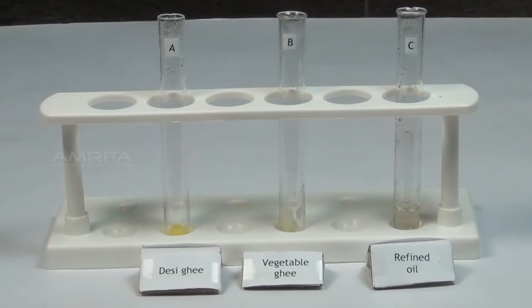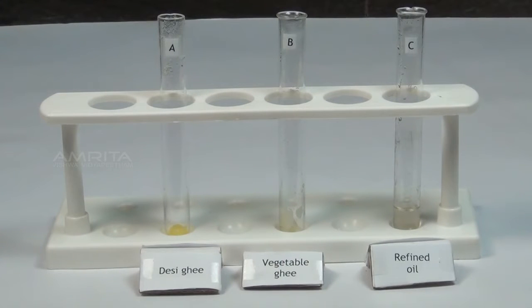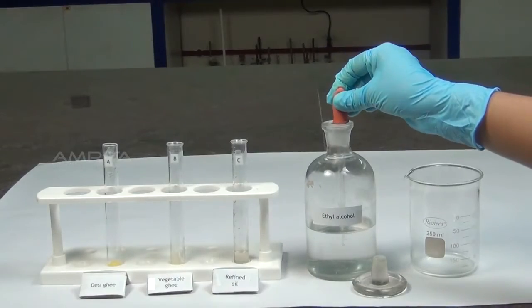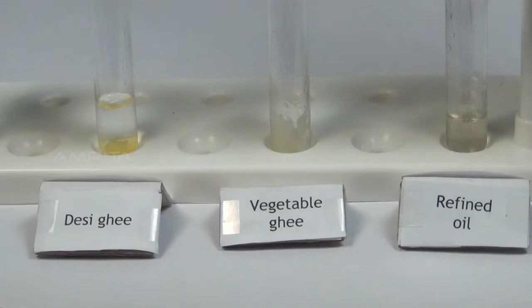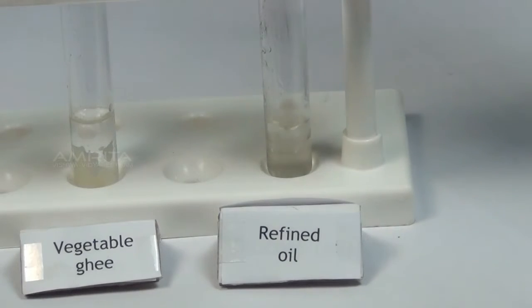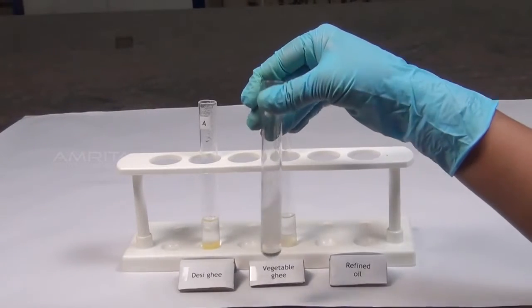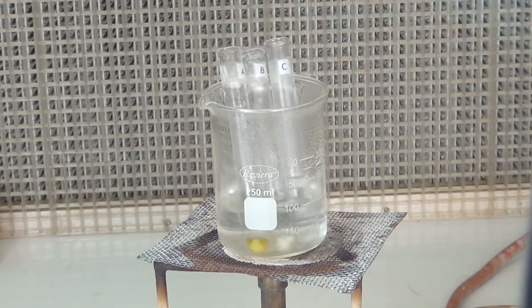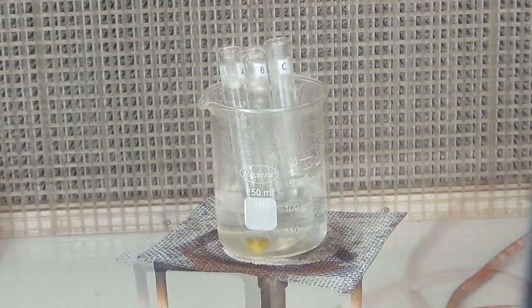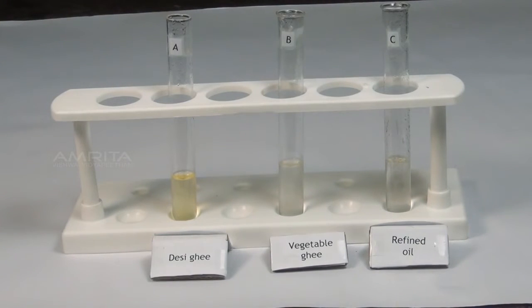Solubility with alcohol. Take a small quantity of desi ghee, vegetable ghee and refined oil in three test tubes A, B and C respectively. Using a dropper, pour a small quantity of ethyl alcohol into each test tube and shake well. All the samples form a lower layer in alcohol. Now heat the test tubes in a boiling water bath. The samples dissolve on heating, indicating the presence of oil or fat in the samples.